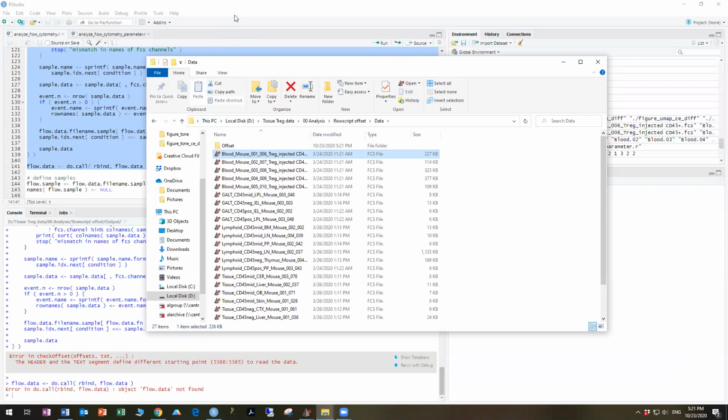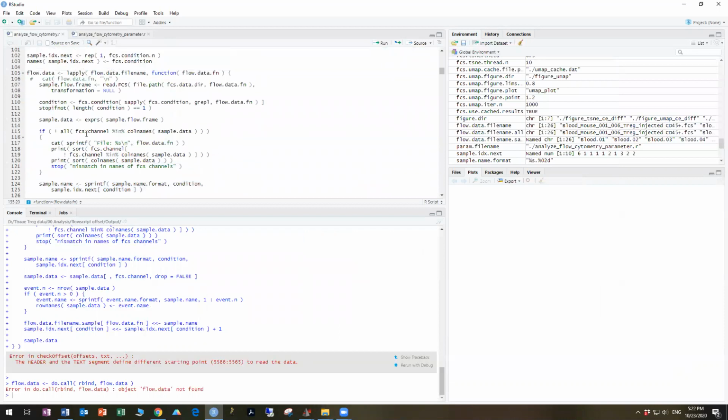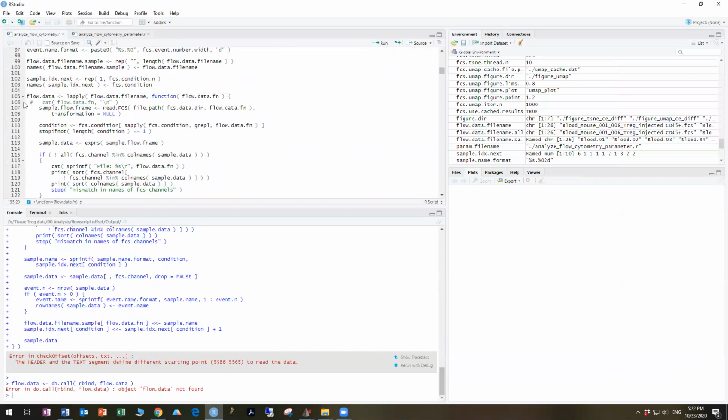So what we're going to do is first try to identify which are the files that are causing the problem, because it doesn't automatically tell us. So for that, we have this command here, which you will not probably have in the default version of the script from Carlos. This is something he showed me that allows you to identify it. So in order to activate this command, we just remove the hashtag. As long as the hashtag's there, it's inactive and the computer just ignores it.